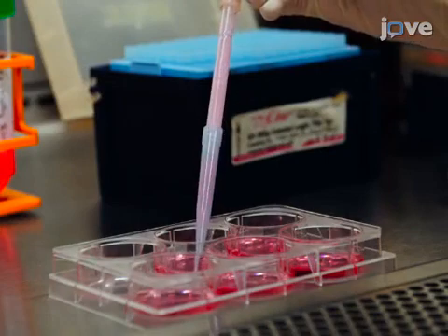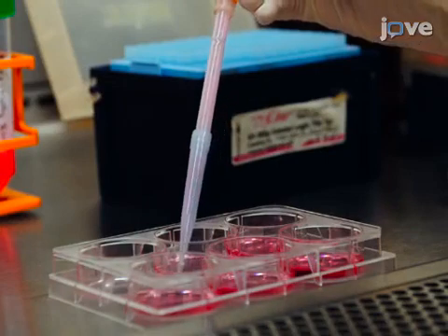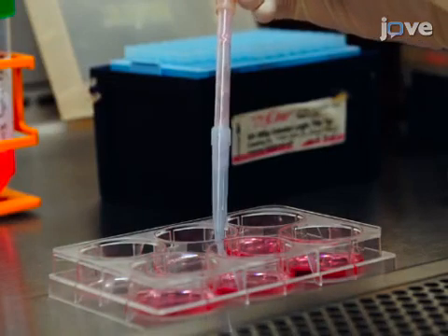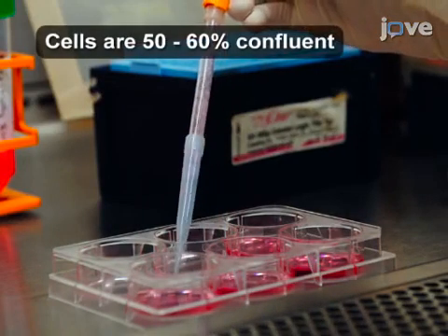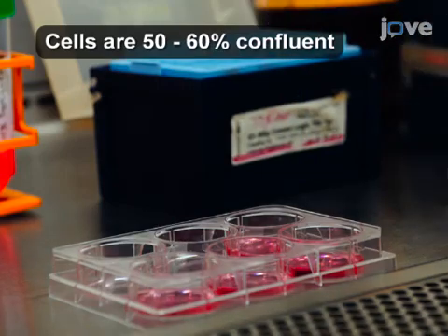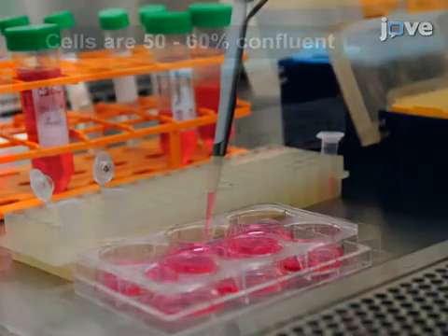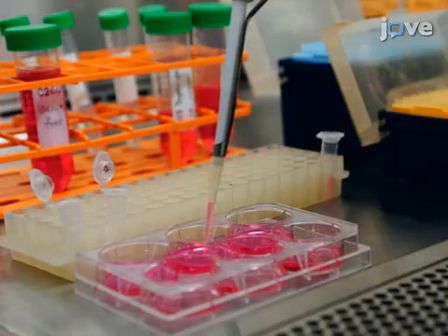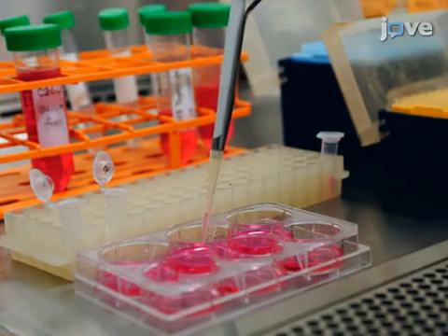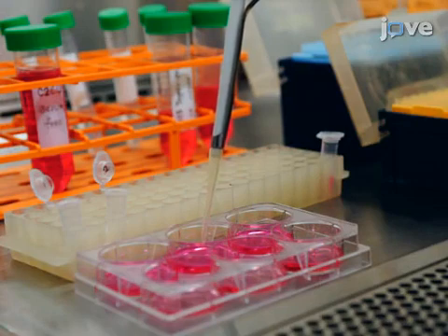During the last 5 minutes of the incubation, replace the medium in each well with 2.5 milliliters of fresh serum-free growth medium and add 200 microliters of transfection mixture to each well.